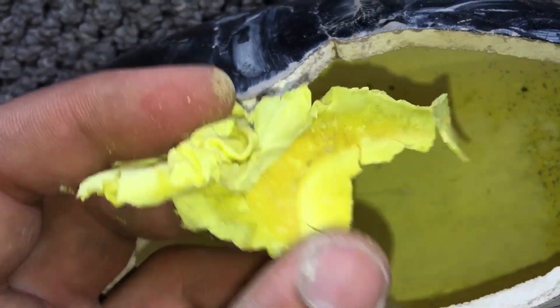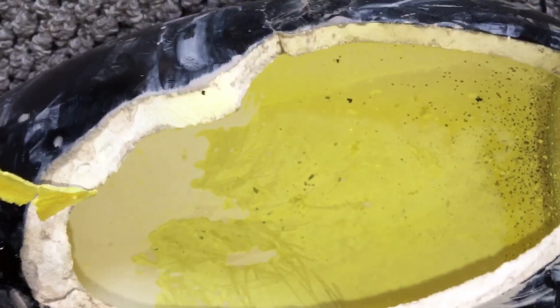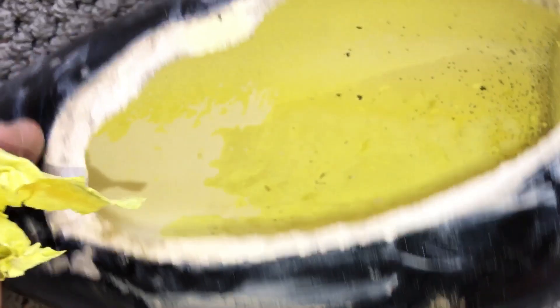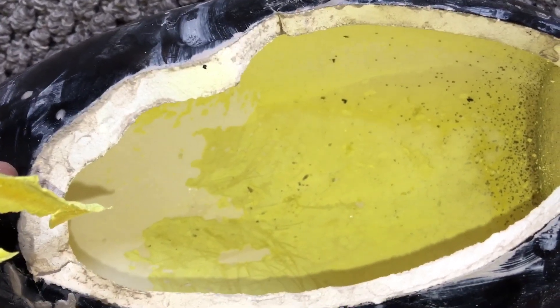You can see it's still flexible and still kind of warm. I'm going to redo this, except instead of using this ceramic bottle, I'm going to try to use a glass bottle. I think it would be a lot easier to clean out, so I'm going to try that.